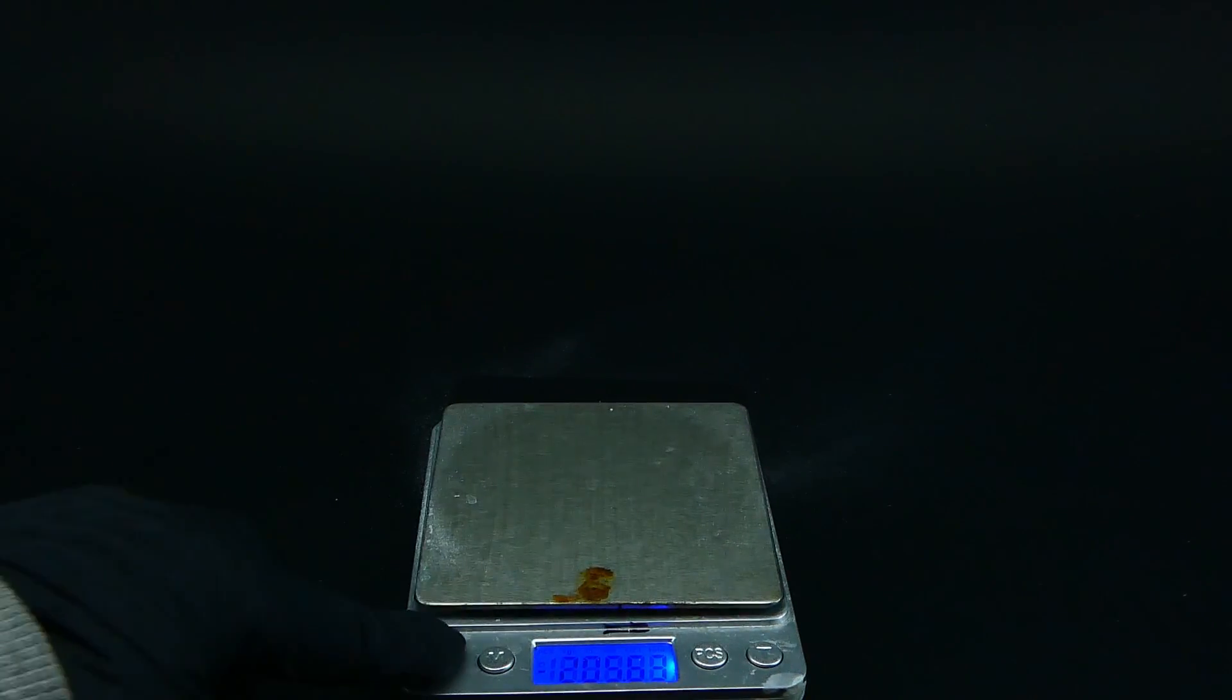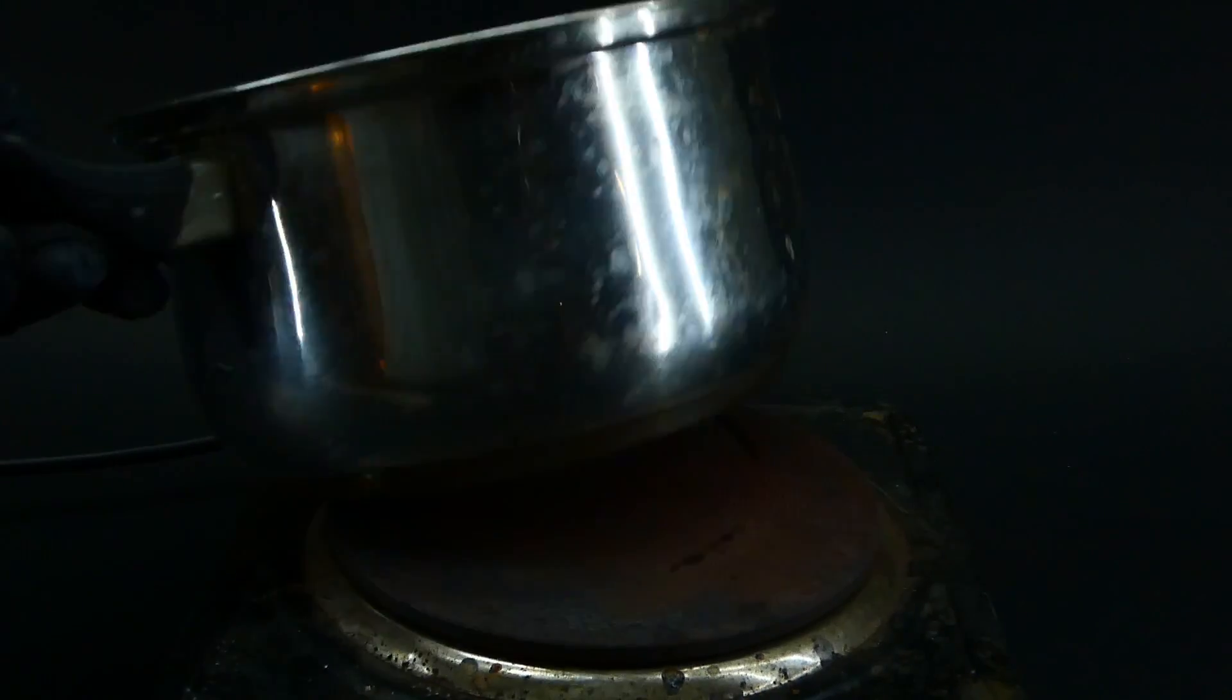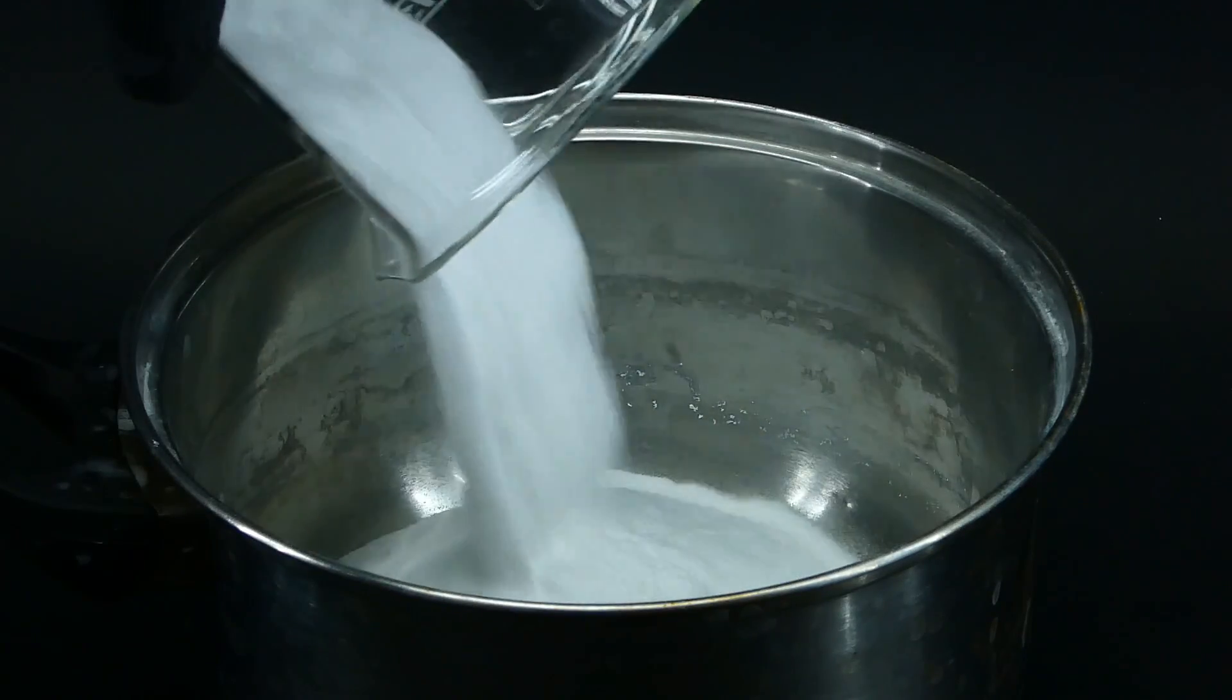When you weighed out your sodium bicarbonate, you can just dump it into a pan or other heat resistant container and crank up the heat.